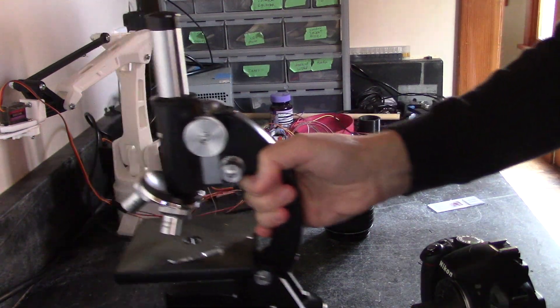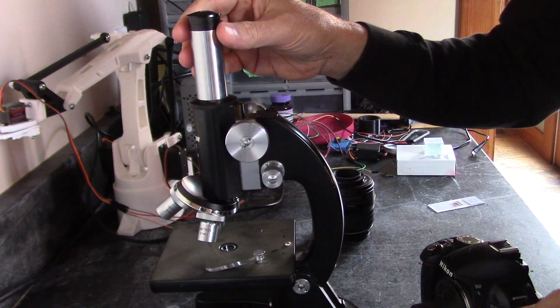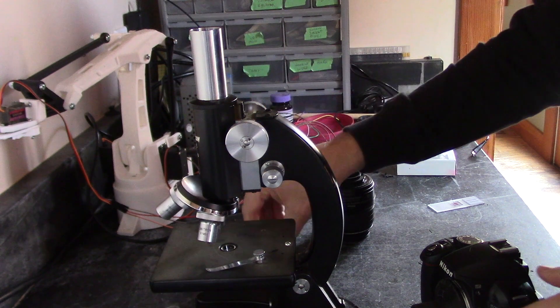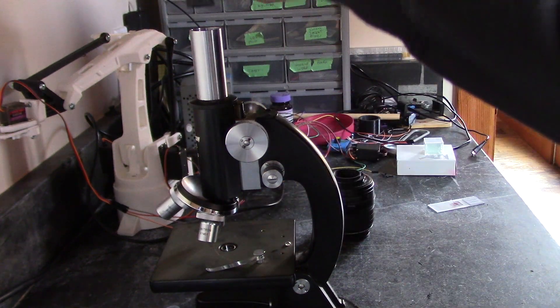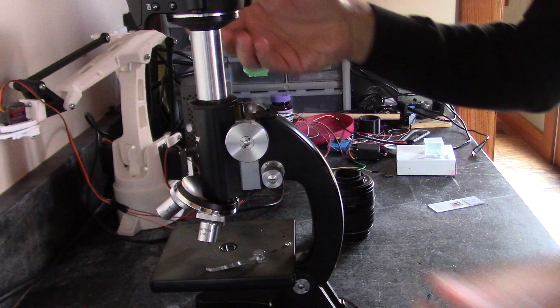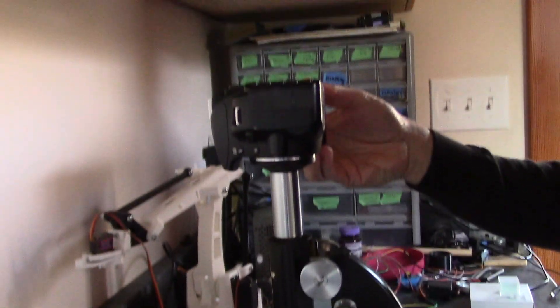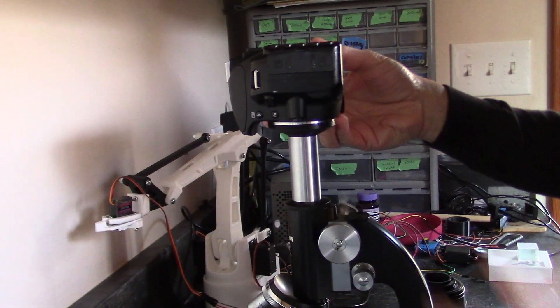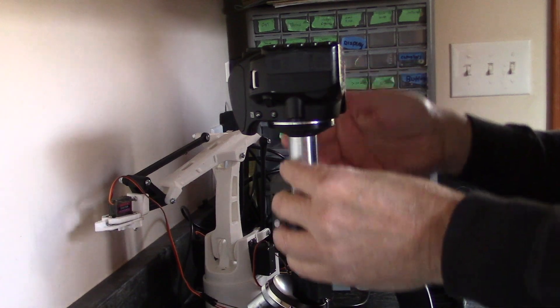Now, here's part of the problem with this type of focusing. If you put it in like this, as you would expect, where it fits just perfectly, let me put the camera up so you can see that. So that fits just perfectly and it's straight up and down.